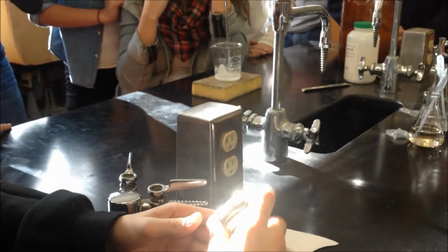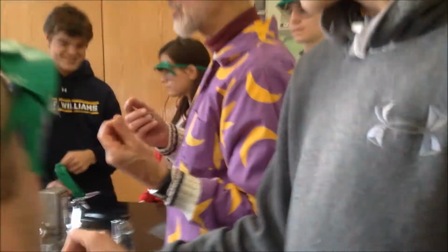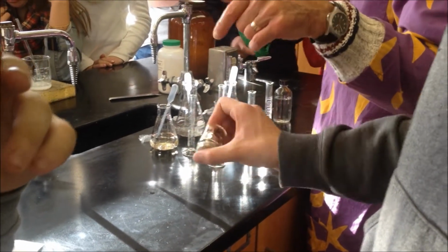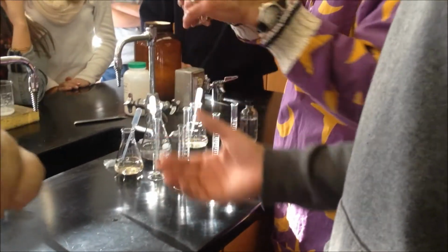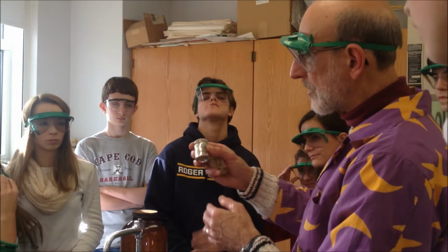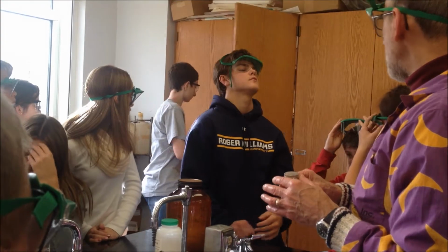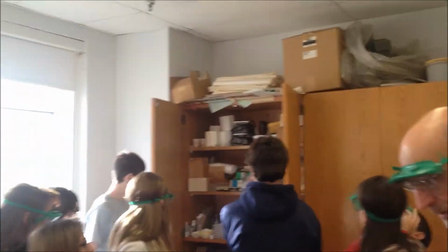Okay, so what's happening? It's a mirror. Mirror coated it. Yeah, right? This is called the silver mirror reaction. This is how they used to make mirrors. So there's a coating of silver inside. That's the tarnish, like if you have something silver and it turns brown. I'm going to rinse them out, then you can take it. On the inside, it'll turn brown, but because this silver is protected by the glass, this part won't turn, so it'll stay silver on the outside. In fact, open the two closets there on the left, and look at all the silver stuff from other years down there.